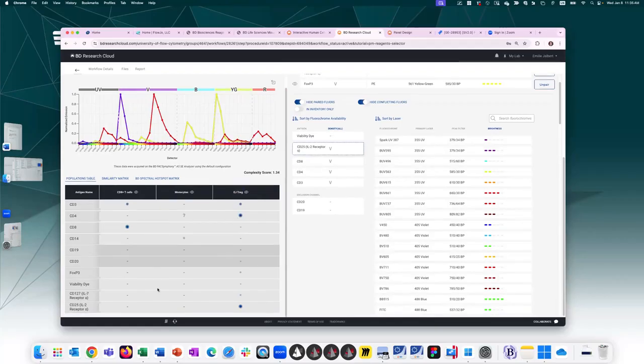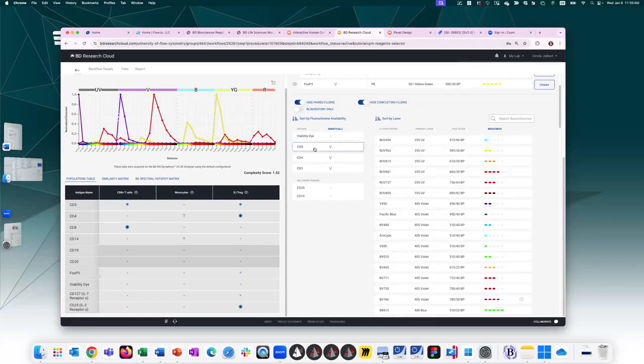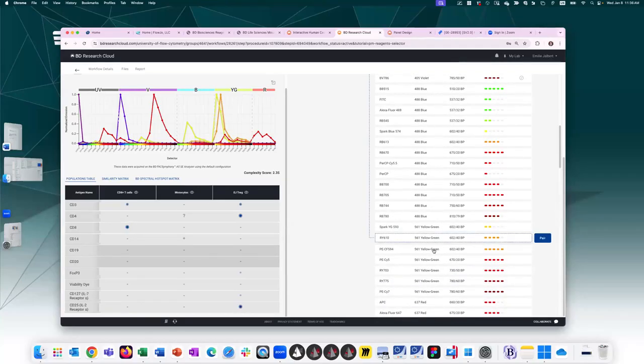So CD25 now is nice and bright over here, so I'll want something dim. So looking at the dim fluorochromes, this one is nice and dim. It's out of the way. Let's go ahead and do that. CD8 now is bright, so I want something dim. And what I'm doing is I'm looking to see where are my spaces that I haven't already assigned fluorochromes. These are sorted by laser line, so I'm scrolling down: violet, blue, yellow, green. Let's start over here. That's not bad. Let's go ahead, real yellow.